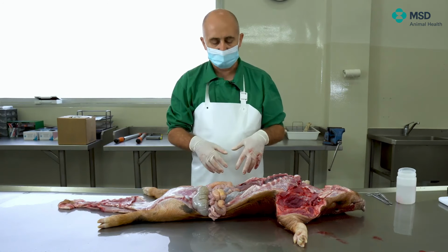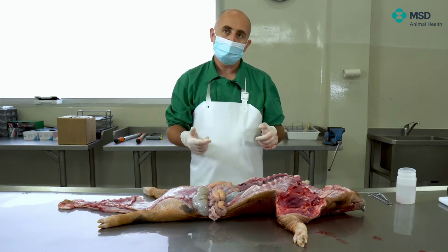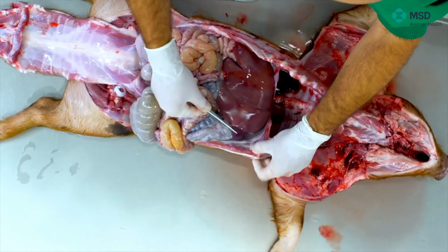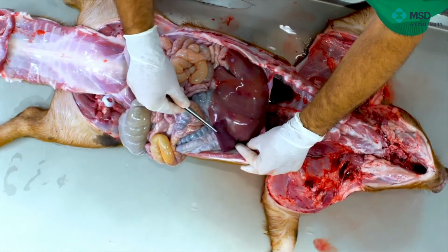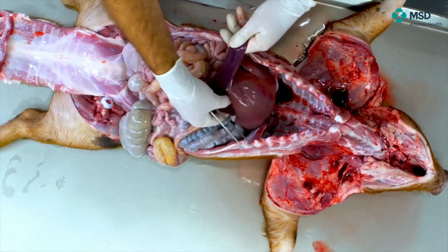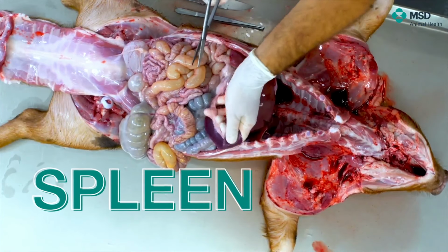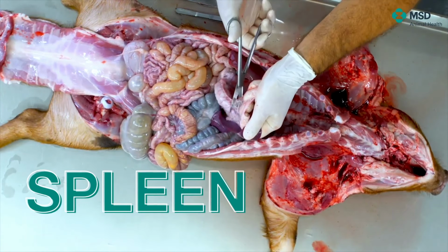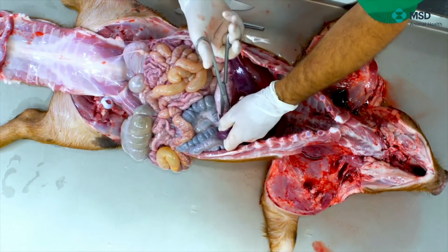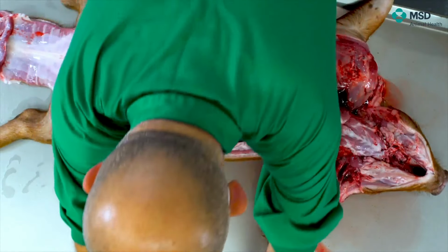Also, we will remove, first of all, the spleen. The spleen is very easy to see in here. So it's, as you can see, this organ, which is quite hidden here, but it's not that small. So as you can see, we have the spleen in that part, and what we will do is to separate it using the omentum, which is attached to the stomach, in order to remove the spleen in its globality. So we have the spleen. We will leave the spleen as well for further study.